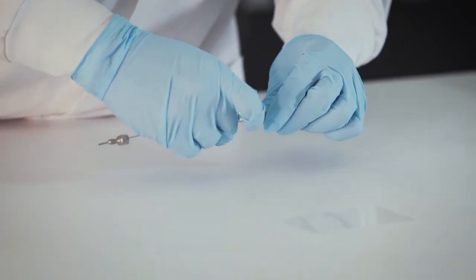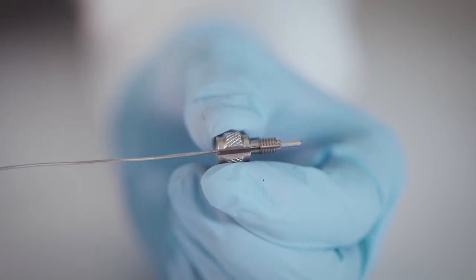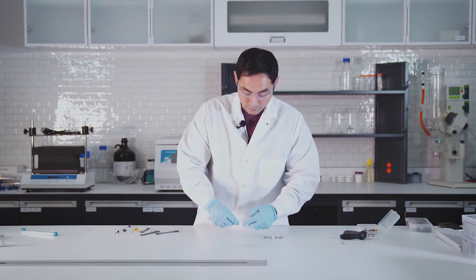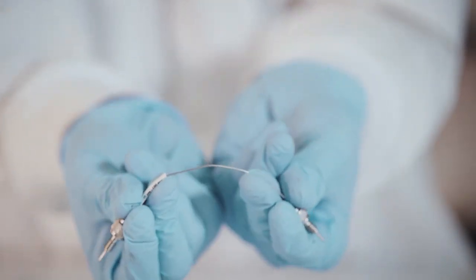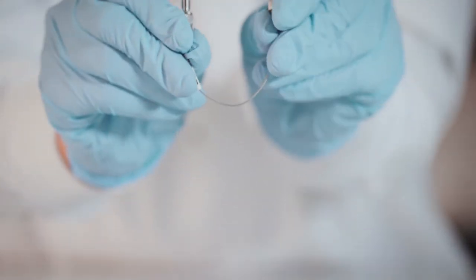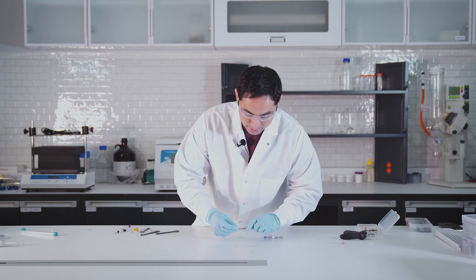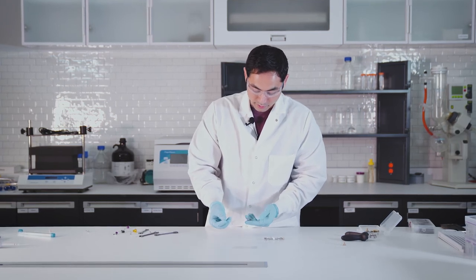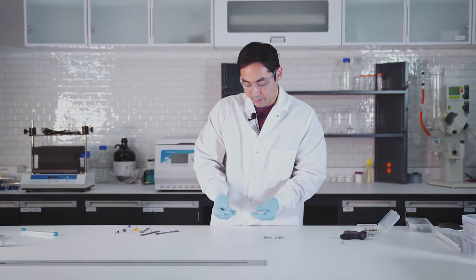The way that it works is you can move the tubing in and out like this, there's no nuts or anything like that. And these are very nice because it's considered flexible stainless steel, so it's very easy and nice to manipulate. Although they're a little bit more fragile, these come in a set and they work in this manner. So this isn't bad.